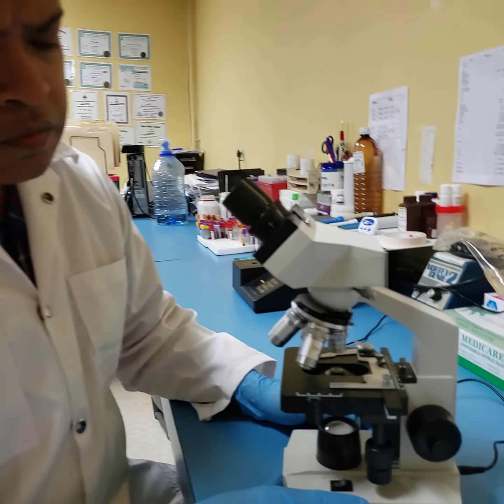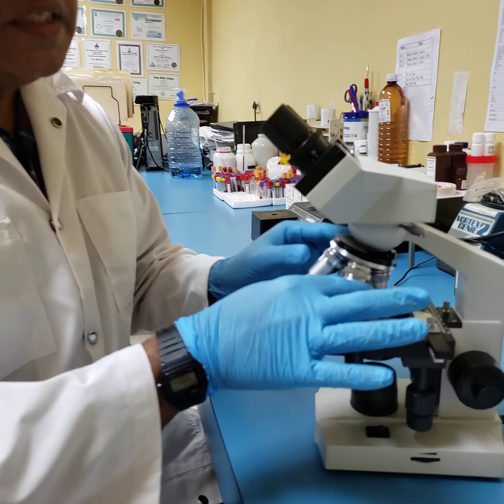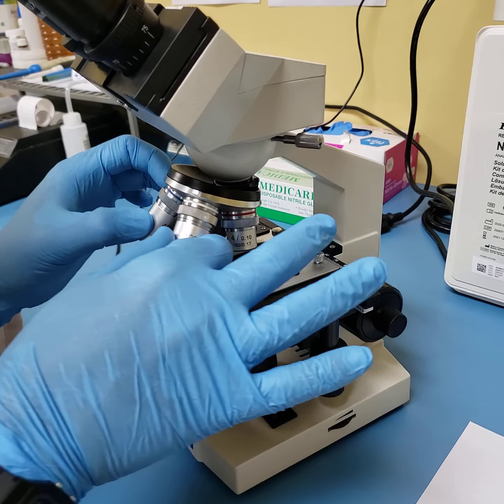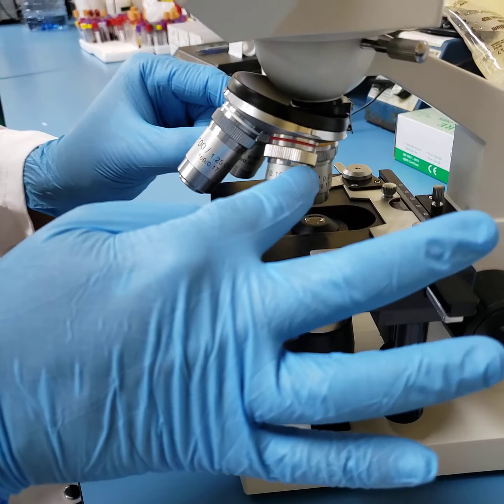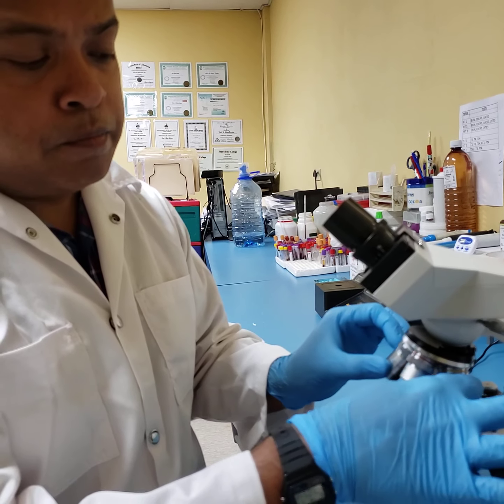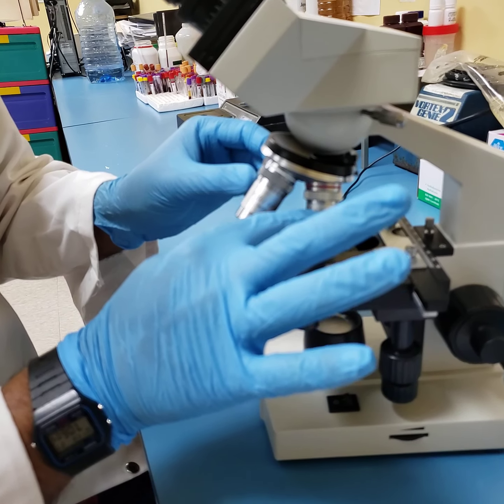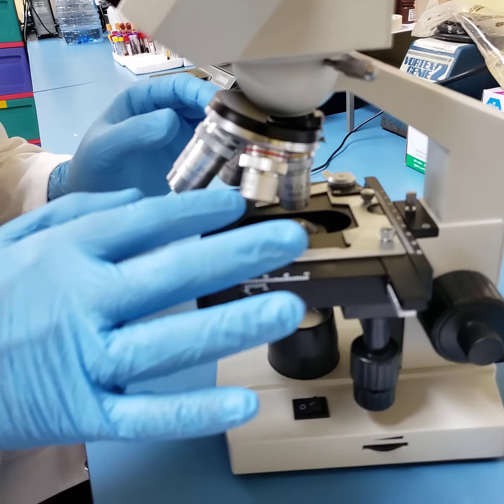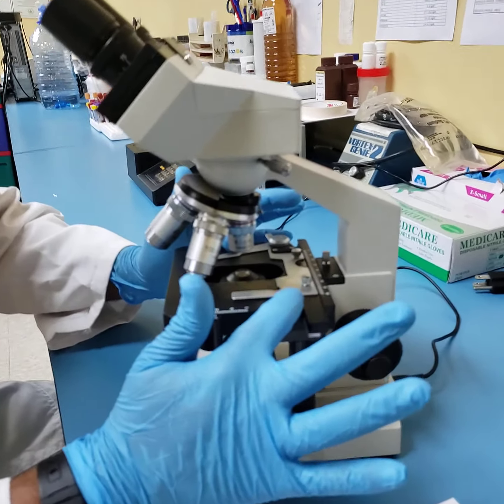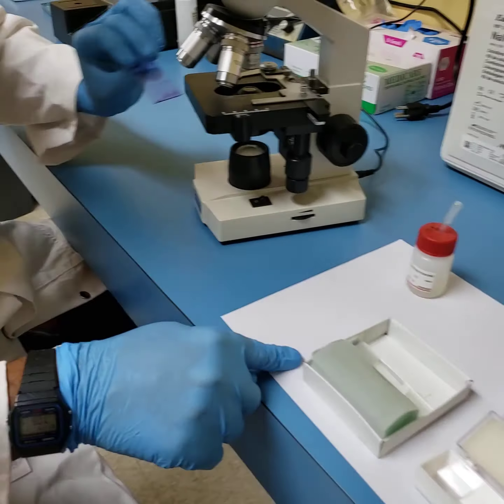The other thing I want to introduce you to is what is called the nose piece. The nose piece is an adjustable circular outlet where you can adjust your lenses. You will notice in the light microscope, lenses come in different lengths, and each of these lenses comes with a different number on them. I will come back to the lenses in a short while. So this is the nose piece. This here is your stage. Your stage is where your slide is placed.